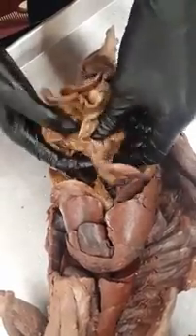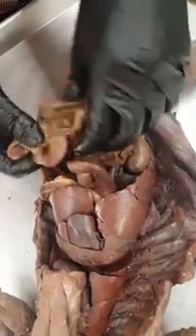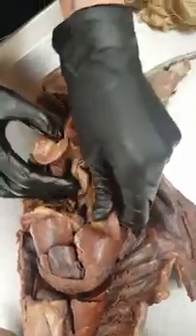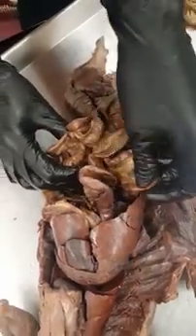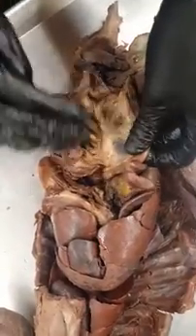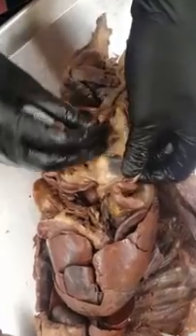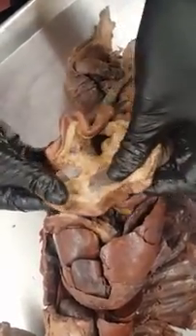Once that is finished it moves along the small intestines. The more anterior part of the small intestines is called the jejunum, which is the primary site of absorption. You can see that the small intestines is held together by a fascia-like sheet called the mesentery, which helps keep the intestines from going every which way. The more distal part of the small intestines is the ileum, which is still responsible for nutrient absorption and reabsorption of water.